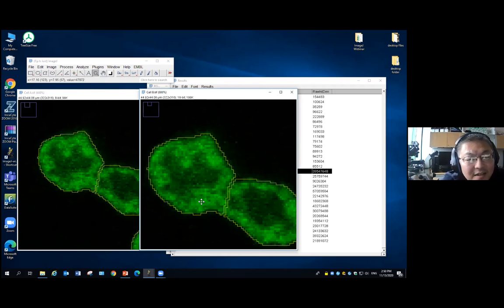It changes how the detector on your acquisition system, your camera, digitizes the signal. So many times, if you look closely, when you're doing confocal or using a CCD, in the acquisition software there are choices for what the output data is: 8-bit, 12-bit, 16-bit. For the camera, you can also choose what format you want to use to take the picture. If you don't pay attention to that, sometimes it can change.